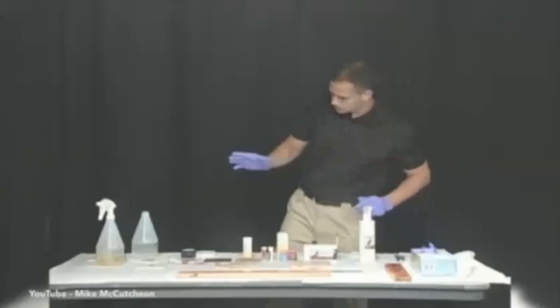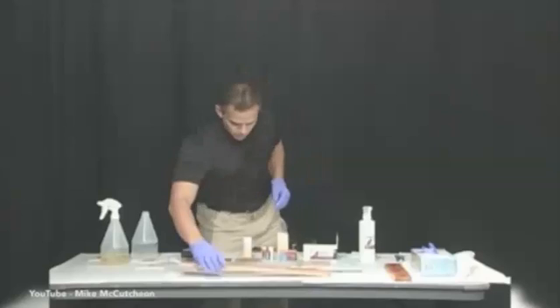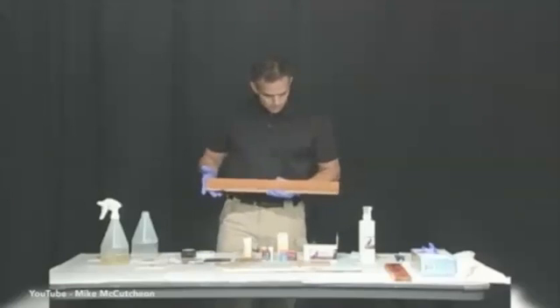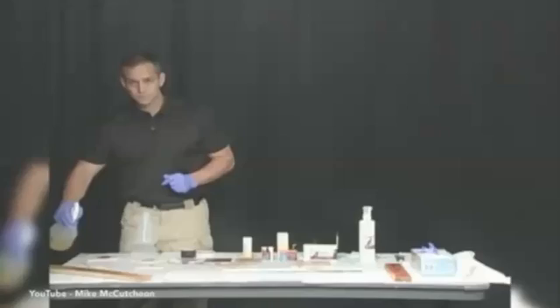Now we're going to get started with our night shooting. We'll start with the Bluestar. Here is the piece of wood I showed you earlier that I wiped with a cleaner. I'm going to put it in close up and spray it to see what we get for results. This was a big stain — I didn't have the sprayer on a fine enough mist, but you can clearly see how bright that is getting with the Bluestar spray.